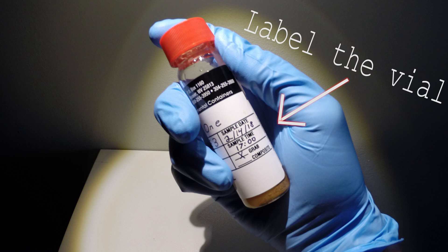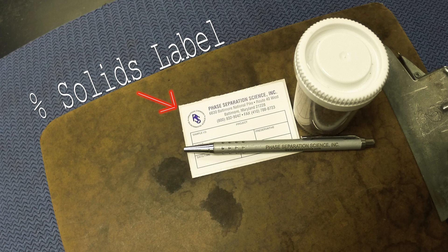Please be sure to write the sample identification on each of the vials and use the provided label for the percent solids container.